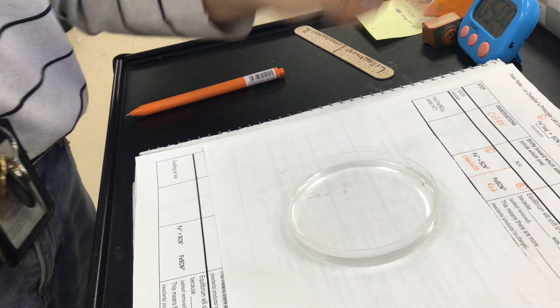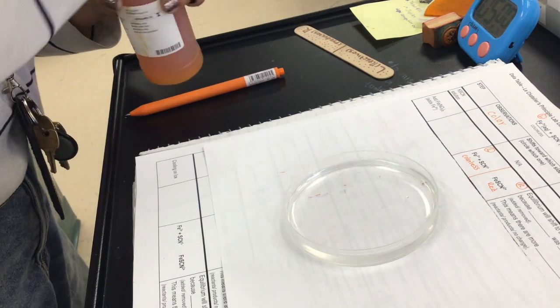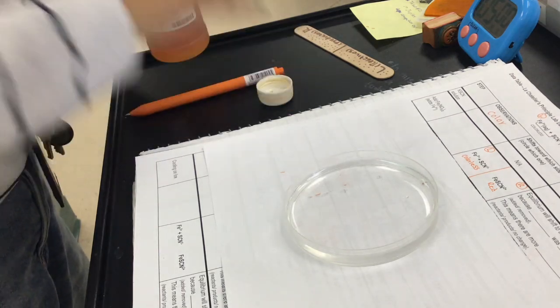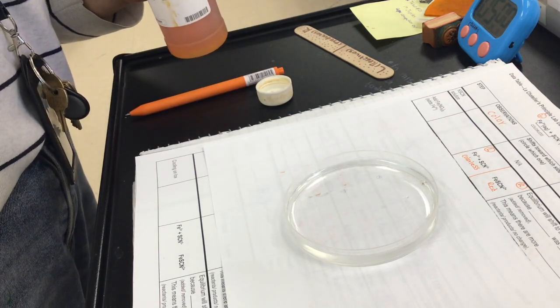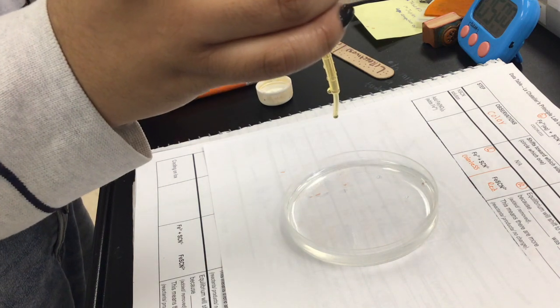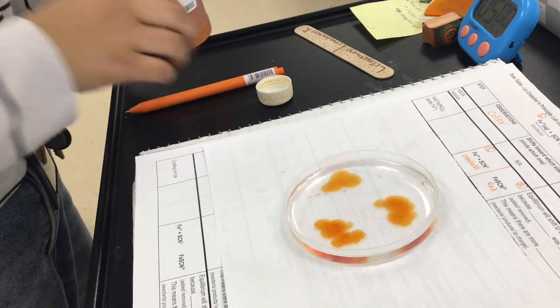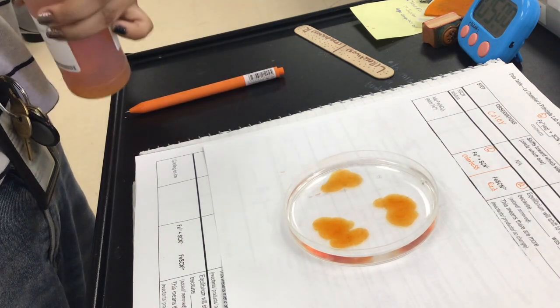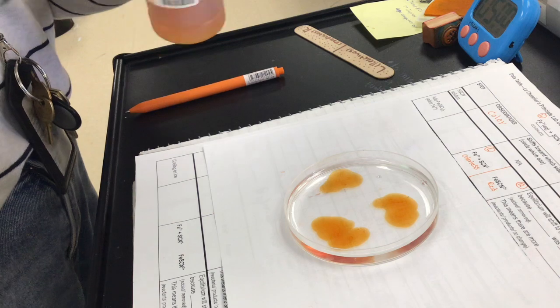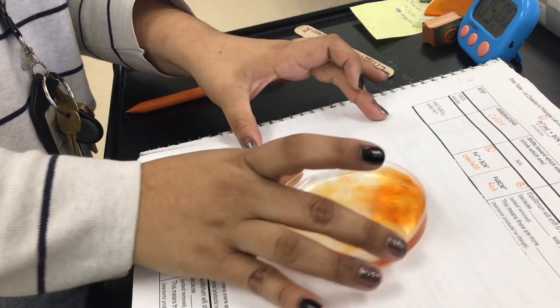Okay, and this one is to add some iron nitrate, which is gonna be adding some Fe. This is just the same as your prediction. And if you remember in your prediction, you said that it was gonna turn red towards the products. And remember that instead of like red, it's more like kind of orangey, but we still can say red.